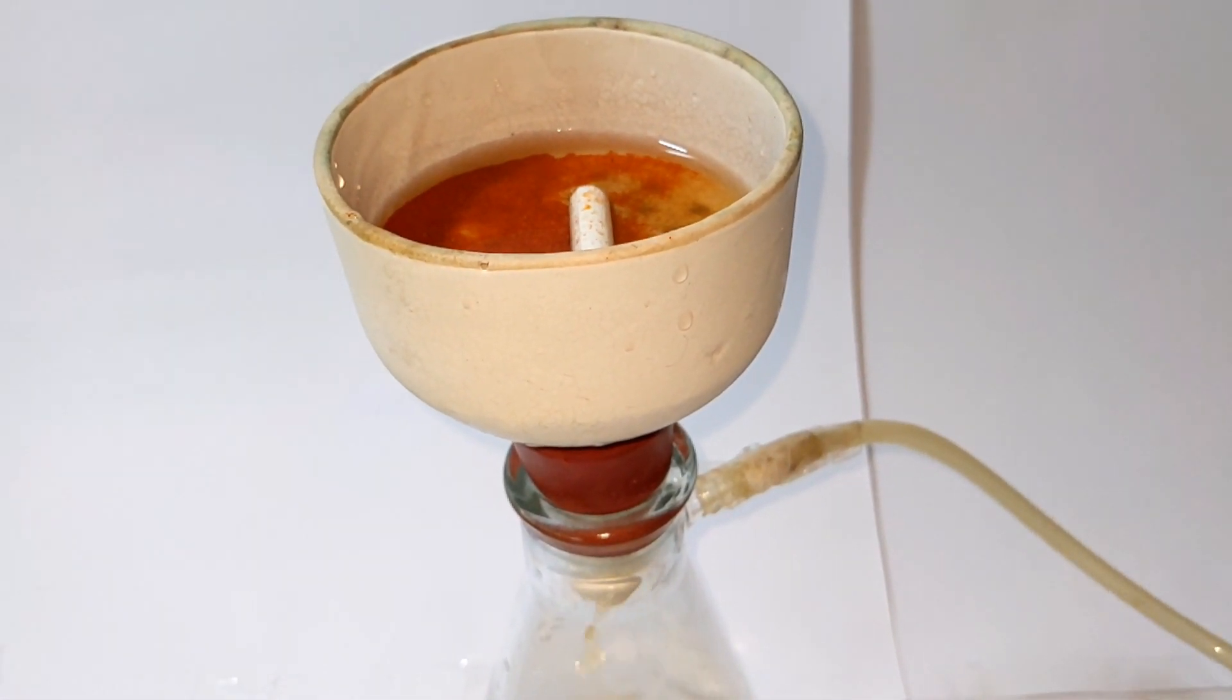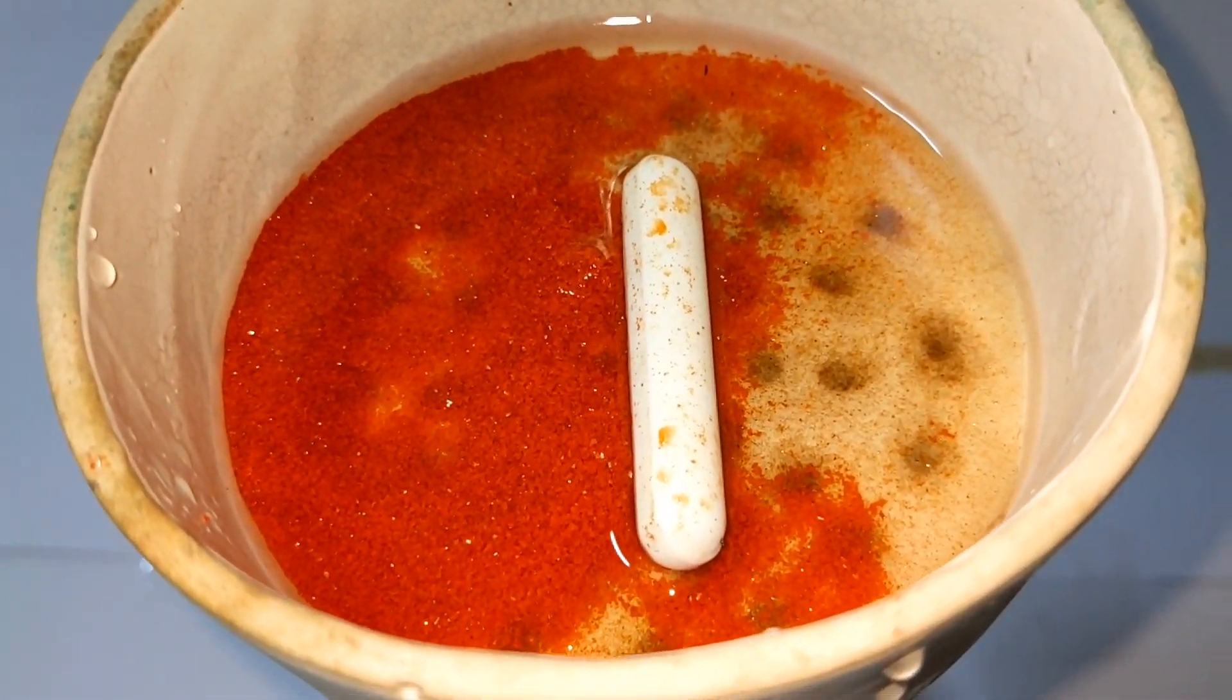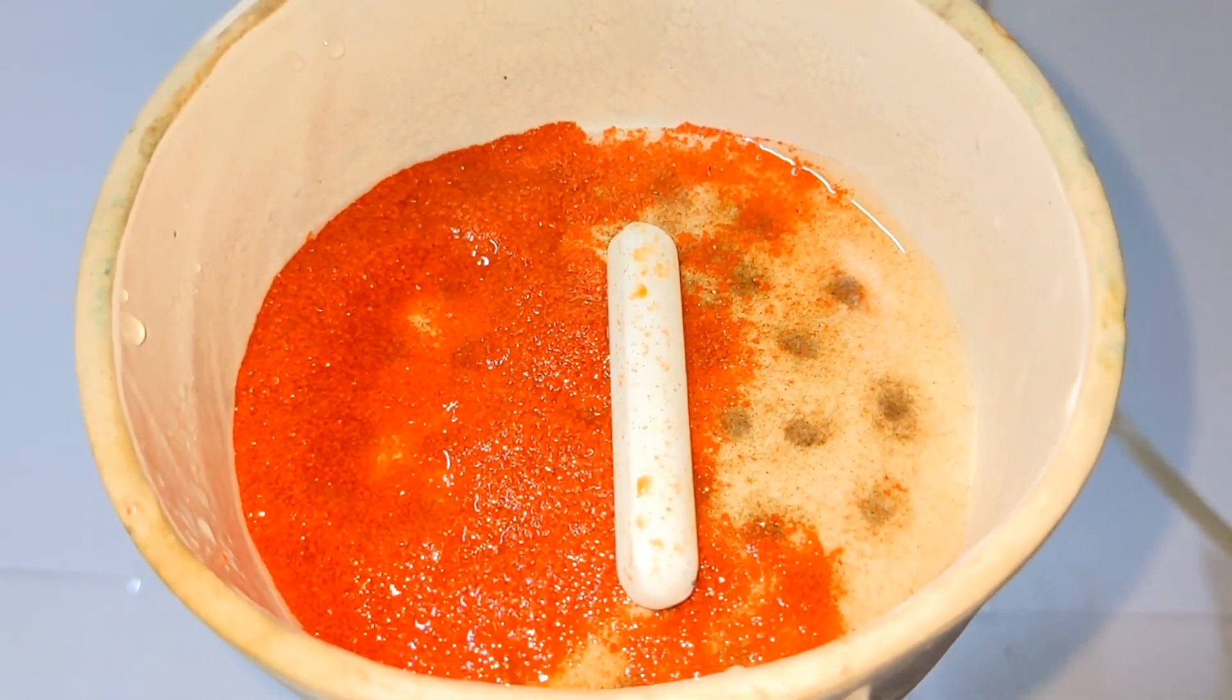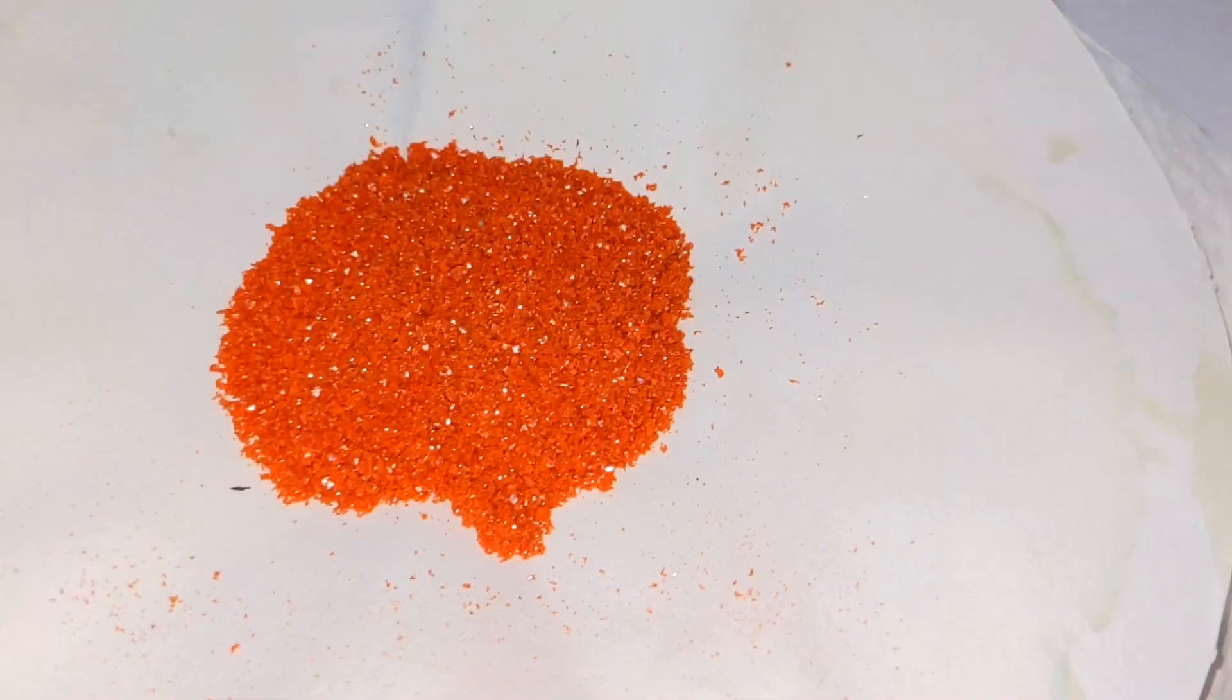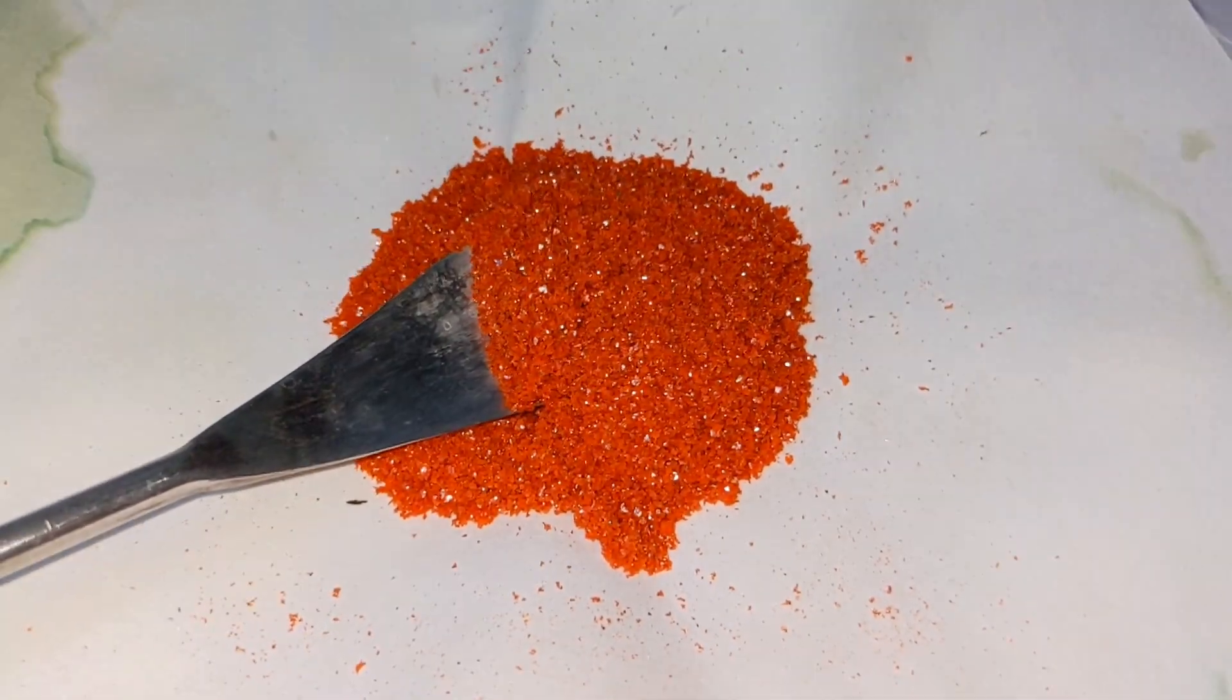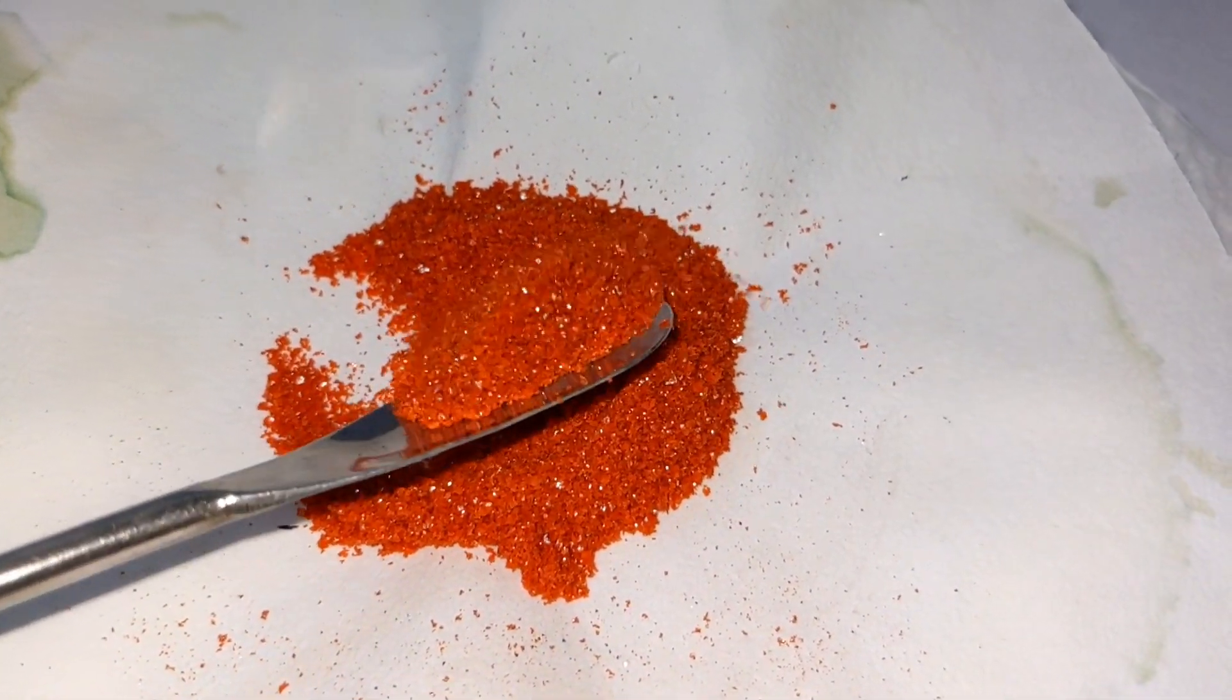Here you can very well see the beautiful orange colored crystals of ammonium nona molybdomanganate. The final product weighed 8.65 grams. So that's all in this video on preparation of this unusual polyoxometallate compound. Hope you have all loved this video.